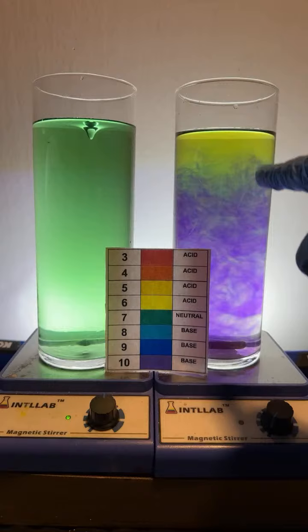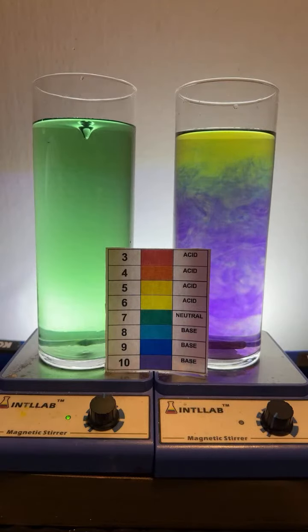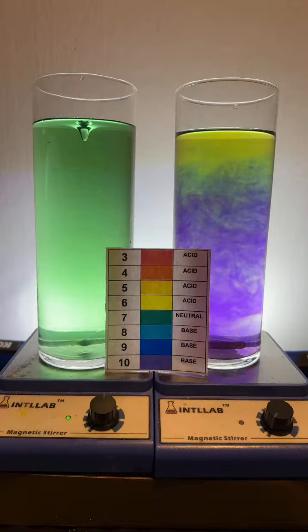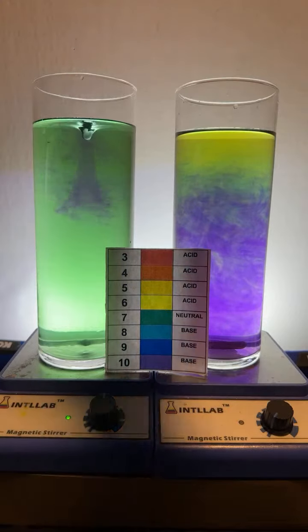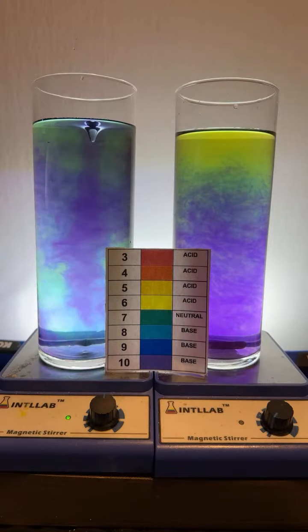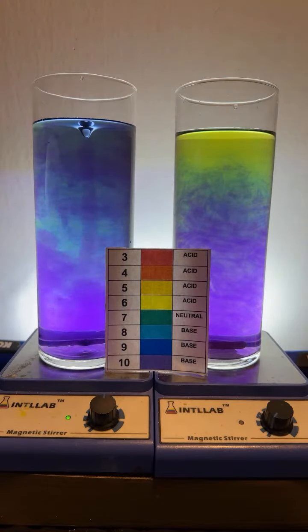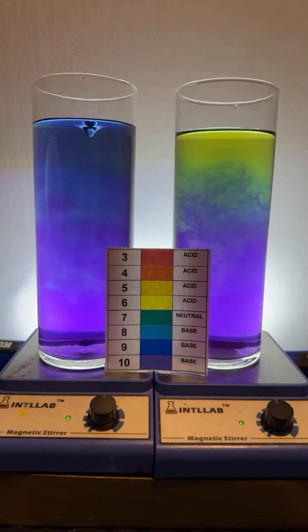It didn't work as well this time, but you can still see the effect is what I think's going on. Happy birthday, Rich. You got it, the ones. Let's add some potassium hydroxide. I mean, okay, this is sodium hydroxide, but it's going to be the same effect, right? The potassium and the sodium has nothing to do with it. It's all hydroxide.